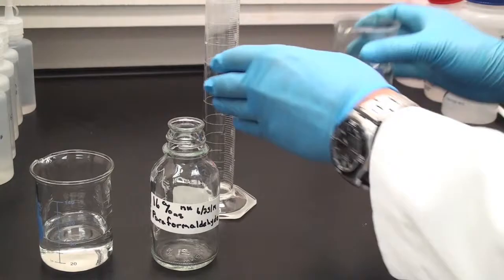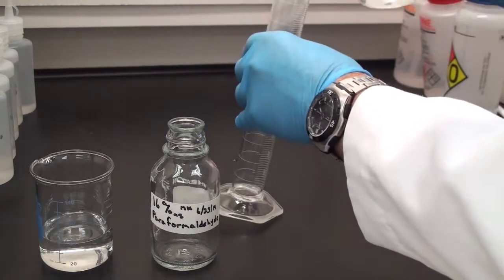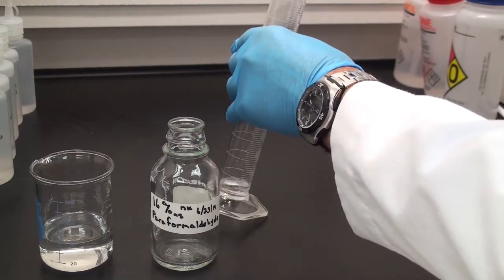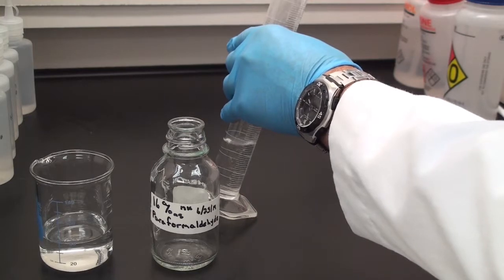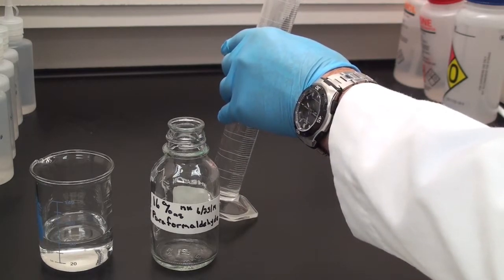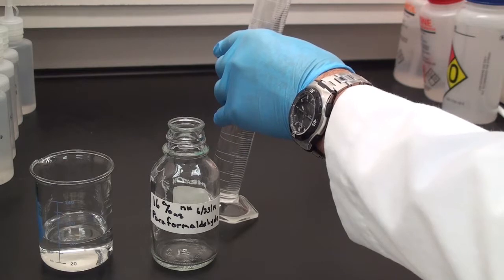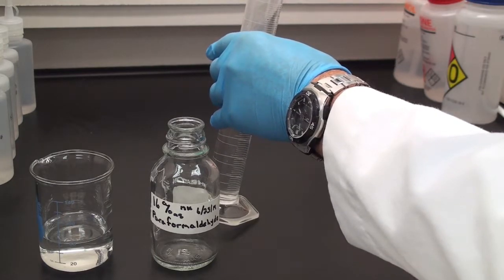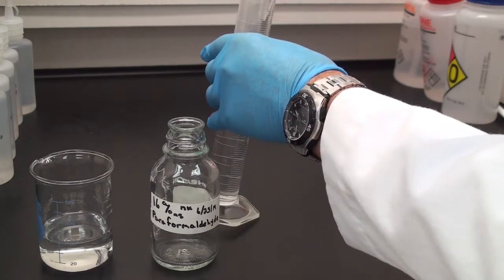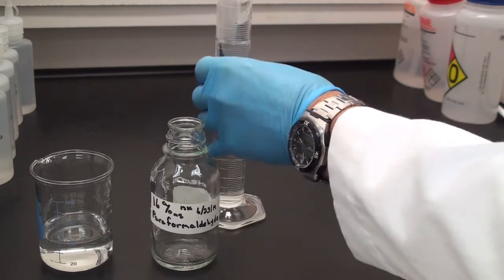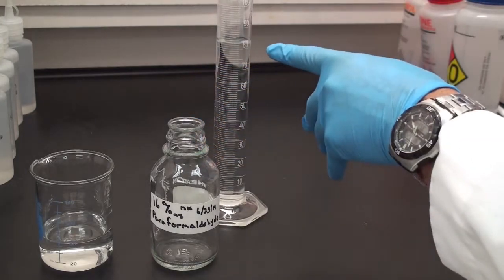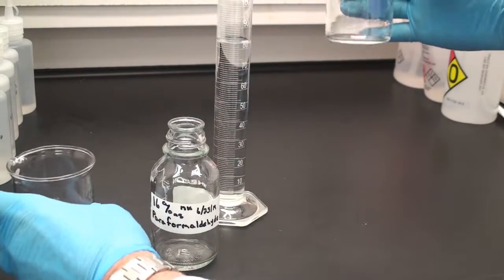What I'm going to do is measure this out. I put in 75 milliliters to begin with and then I put in my 16 grams of paraformaldehyde. We can't know exactly how much volume that 16 grams of paraformaldehyde is going to take up once it dissolves. So as I do that, I see that it's just about 83 milliliters.